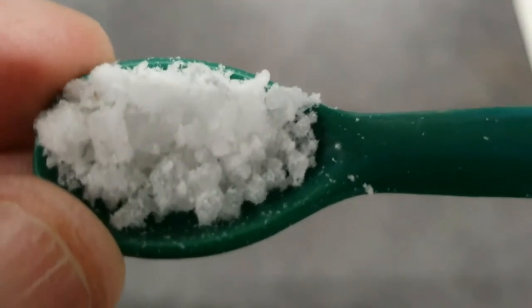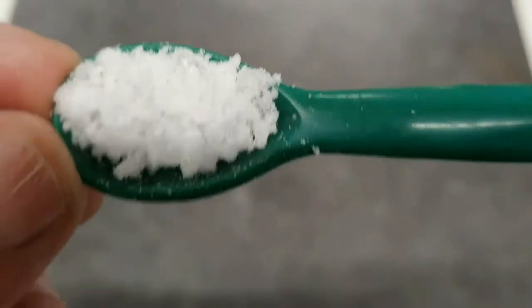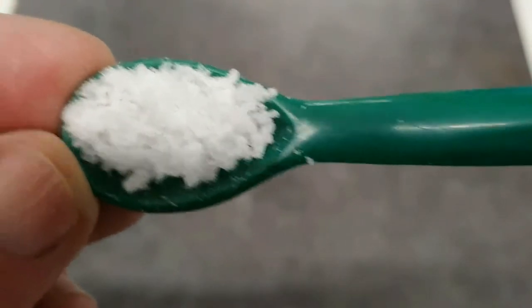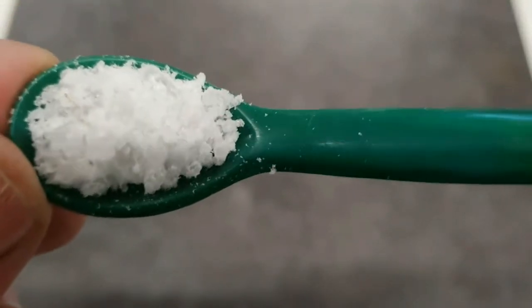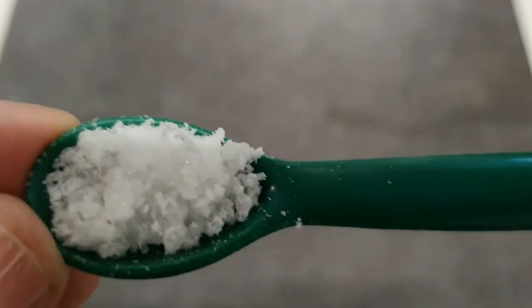So having a look at sodium carbonate decahydrate, first of all, we can say its colour is white. Now, does it have crystals? If we just move some of these a little bit about, we can't see those shiny surfaces. So I'm not going to say that it is made up of crystals.